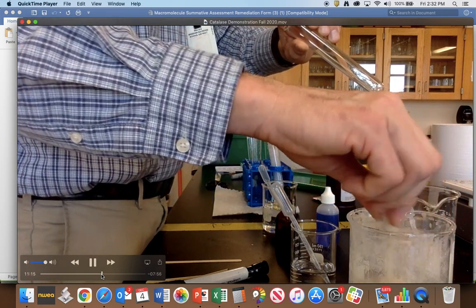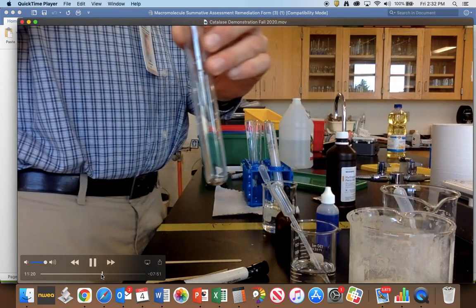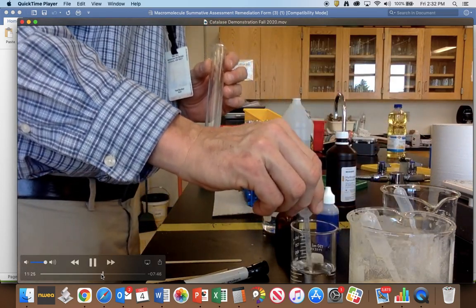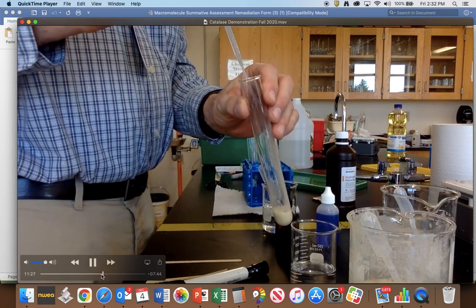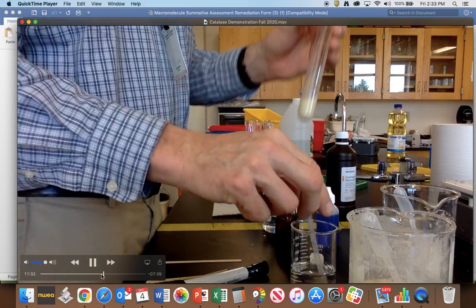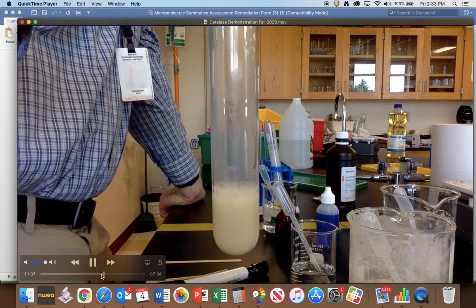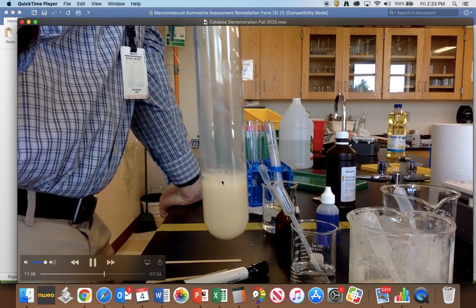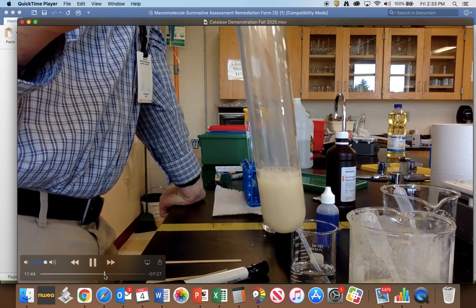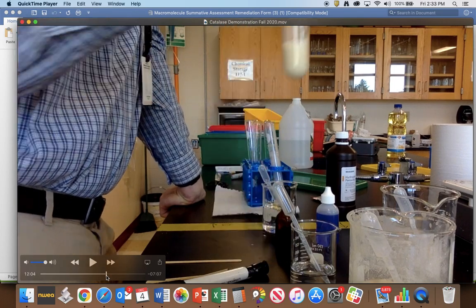And in this experiment, I'm going to put some boiled yeast in. So I boiled that for a while and put some hydrogen peroxide in. And we'll see what that reaction looks like. If it was boiled, that means that the enzyme was denatured. Notice there's no reaction. Those bubbles at the top are just from adding the hydrogen peroxide. So that shows that changes in temperature can affect the enzyme.